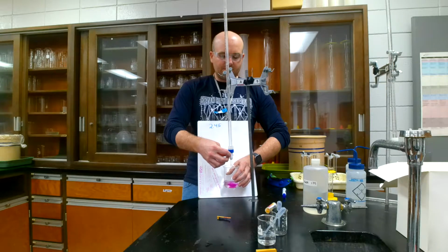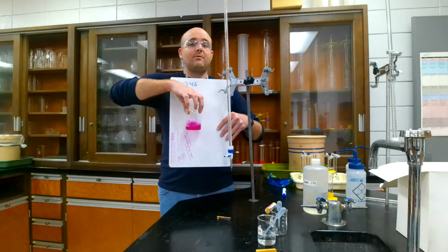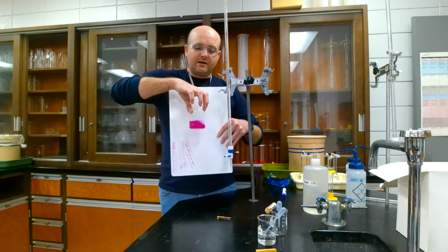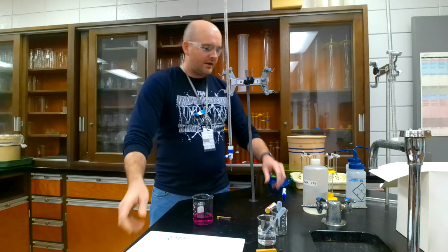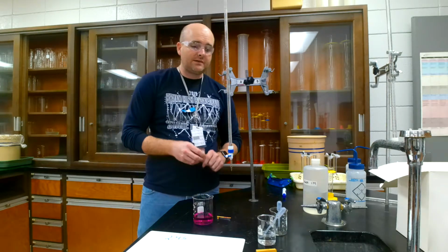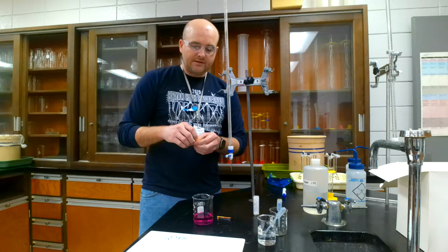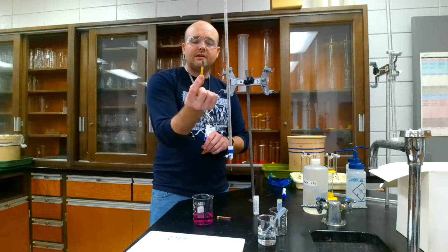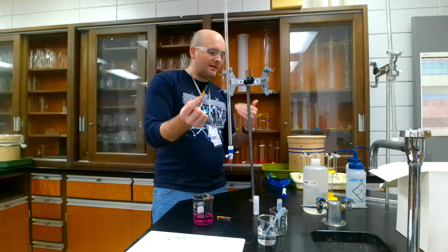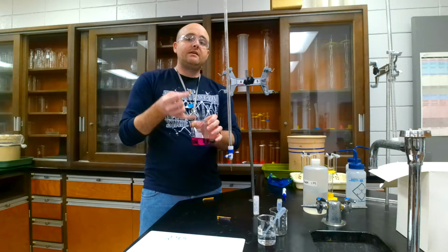Let me show you what it looks like when you push it past the end point. So you can tell that I didn't add too much more, and it became really pink. So this is where it is all basic. At the beginning you saw that it was colorless. So if I took some pH paper now and tested the pH of it, after I've added all that base, I have now gone into the basic spectrum. Right? So I have crossed the threshold from being an acid in here, and I have made it a base.